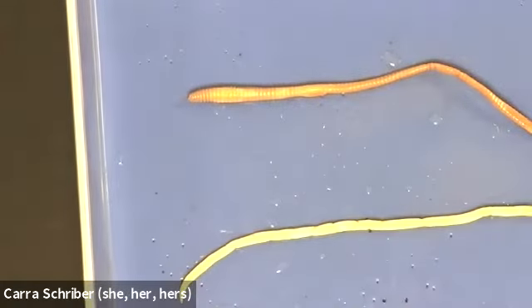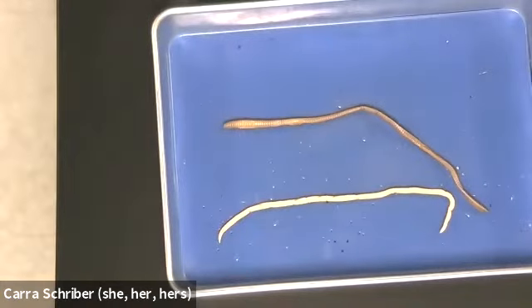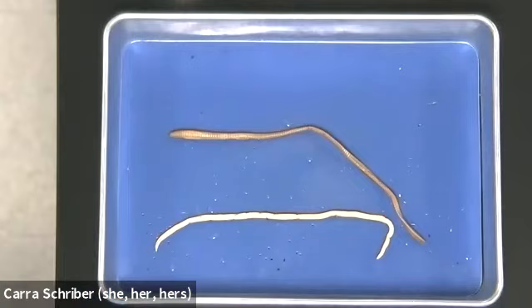So let me get focused here. So we're looking at these 2 different organisms, and there's a lot of differences between the 2, right?